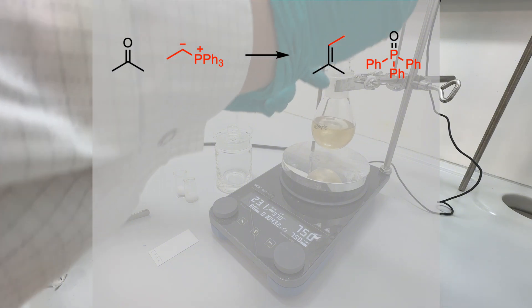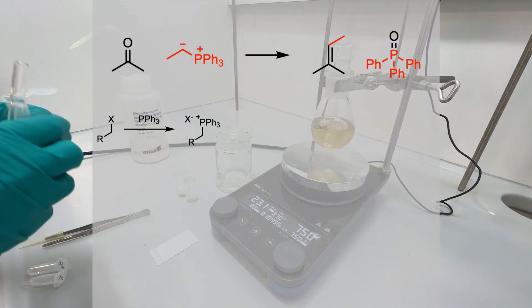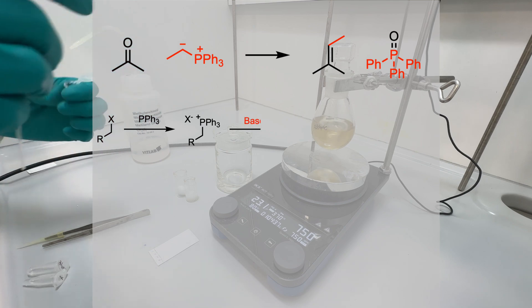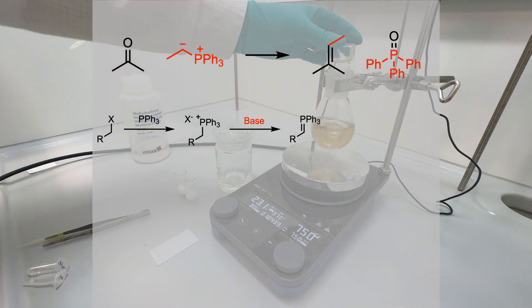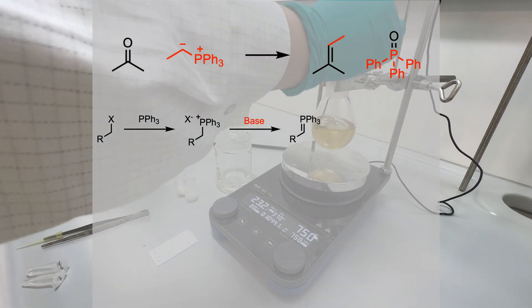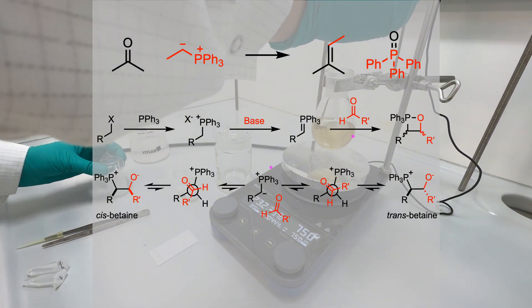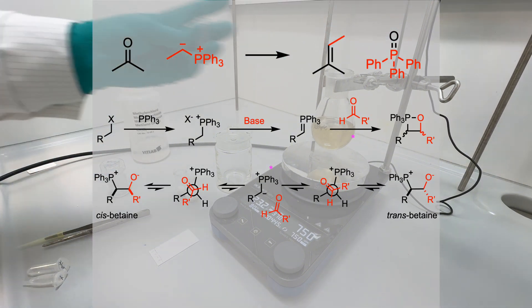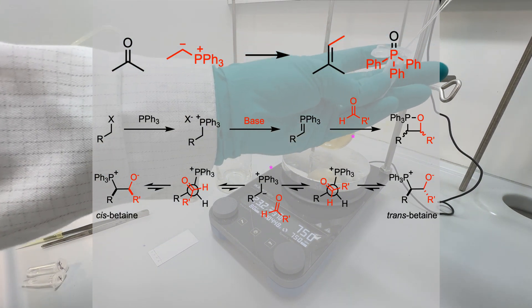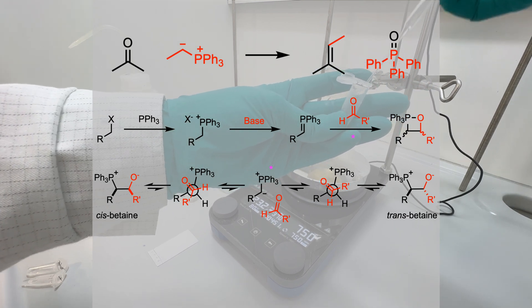The phosphorus ylides can be prepared from an alkyl halide and triphenylphosphine, followed by deprotonation with a suitable base, like n-BuLi or potassium tert-butoxide. Then, nucleophilic addition leads to the formation of a betaine intermediate, which determines the stereoselectivity of the reaction.